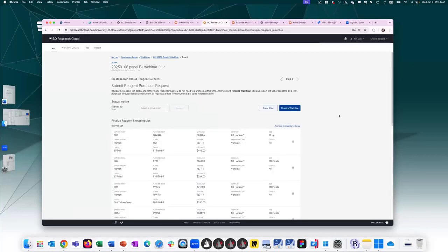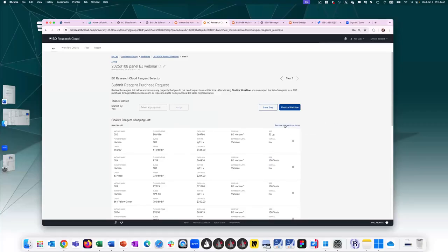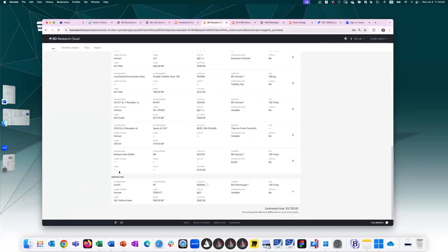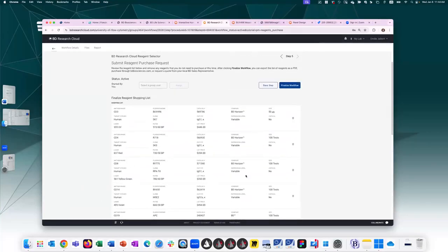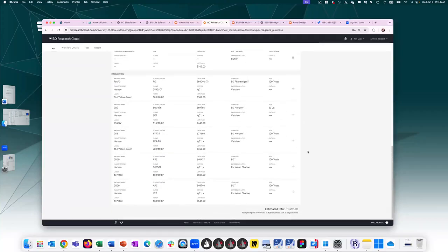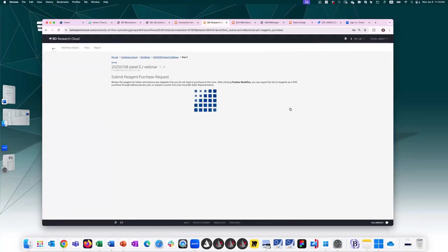And then the last step is just finalizing your shopping list. Because if you are using the inventory, you can just remove the inventory items. I know that I have this in the lab, I can remove it. So by clicking this button, it moved the FOXP3 away from my shopping list, and left everything else that I don't have. If I am not using the inventory feature, not a problem. I can just go through the fridge or what other inventory method I use and remove things that I know I already have. And I'm just keeping the top items to place in order. So now I'm ready to finalize the workflow.